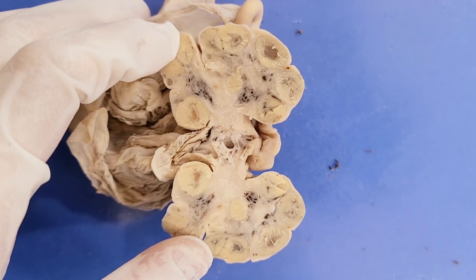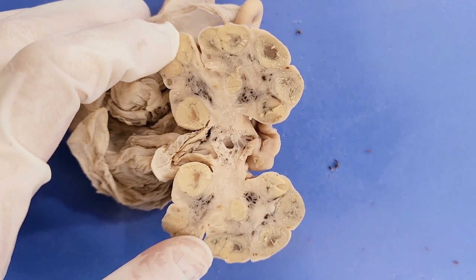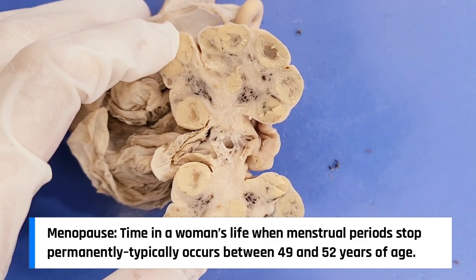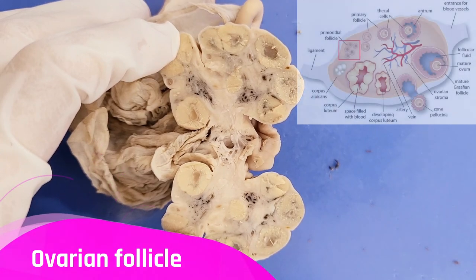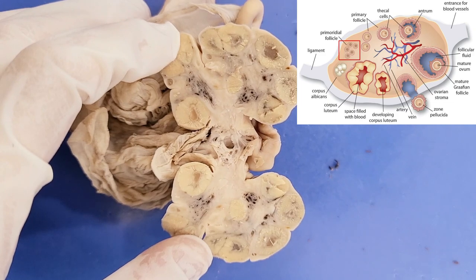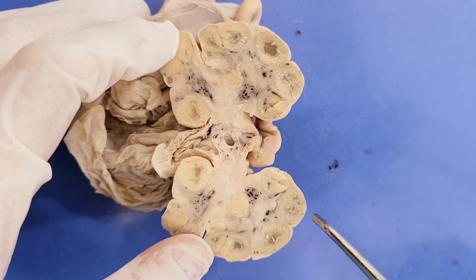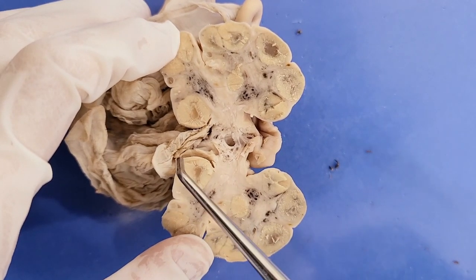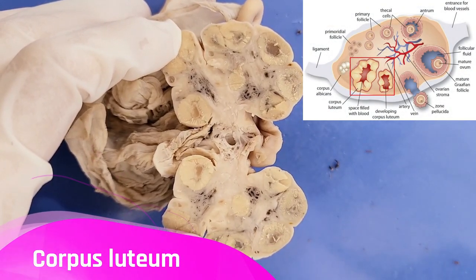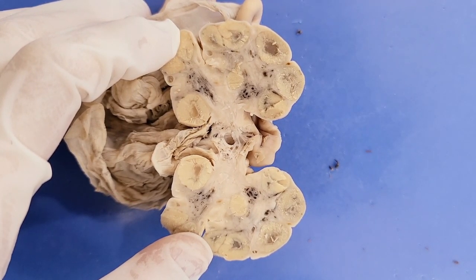All the other eggs degenerate at some point in their development, so very few remain by the time a woman reaches 50 and hits menopause. Each of these eggs is encased in a structure called a follicle, which originally consists of a single layer of cells. You can see some of the follicles here — these yellow circles along the edges are actually developed follicles called the corpus luteum, which we'll talk about in detail later.